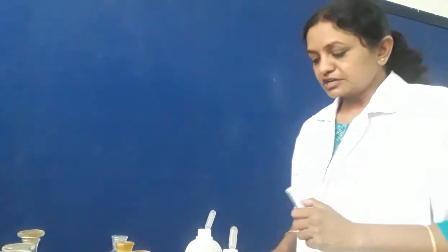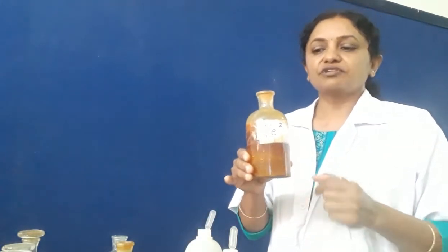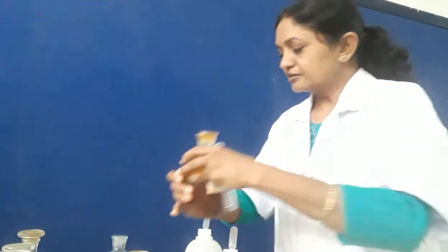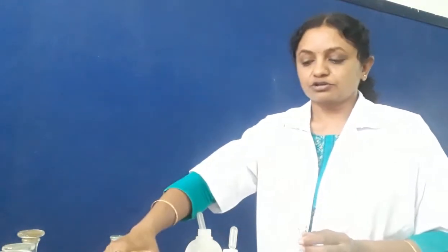Hello students. Today we are going to study detection of cations. For detection of cations we have taken three salt solutions: ferrous sulfate, ferric chloride, and copper sulfate solution. Now suppose I have given you an unknown salt solution and I ask you to detect the cations from this salt solution. So how will you do it?